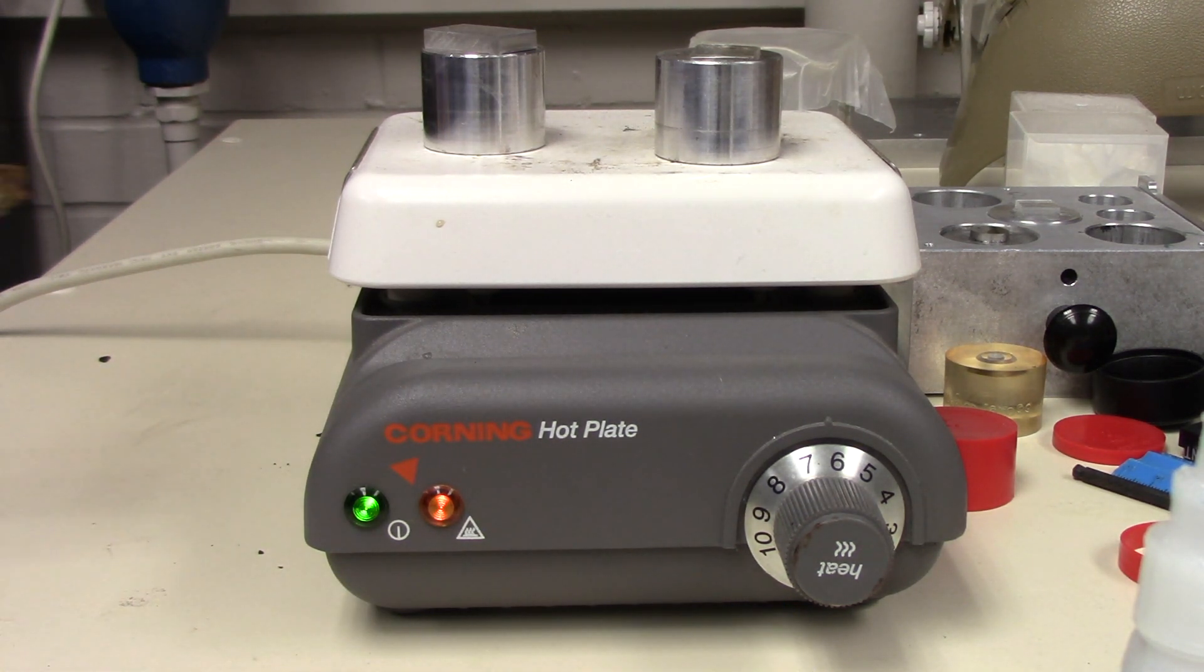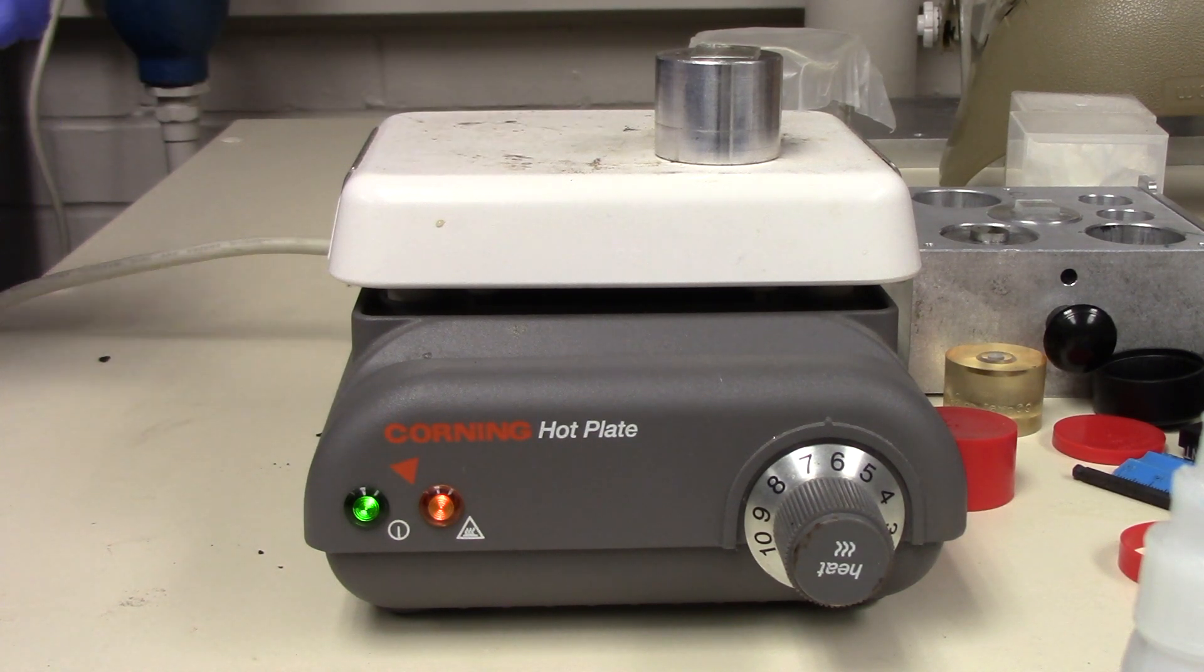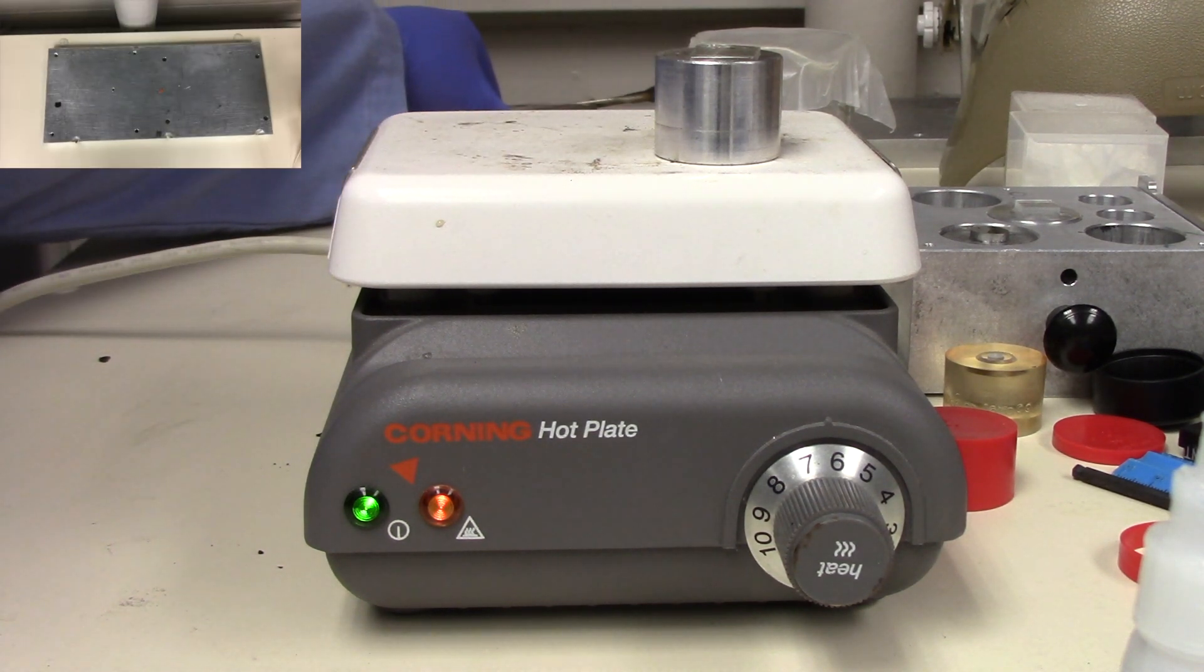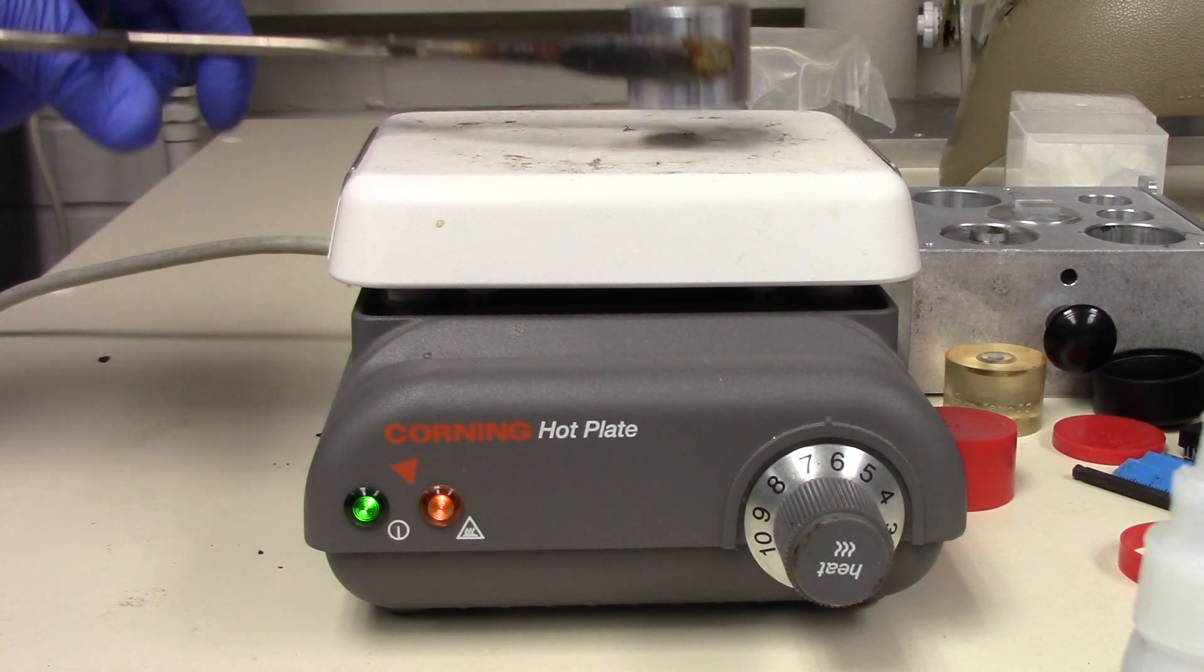Now, once that's done, what you're going to want to do is take these samples off and put them onto the cooling block that we have at the back here so that you allow for them to come back down to room temperature.